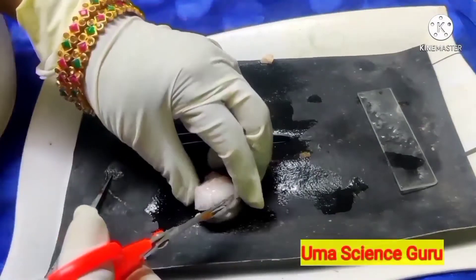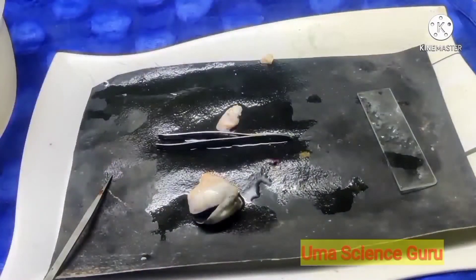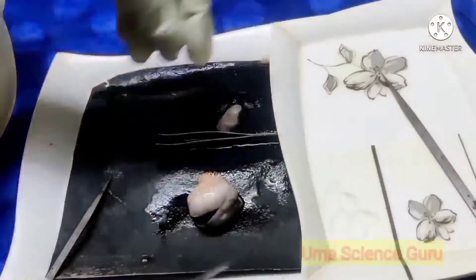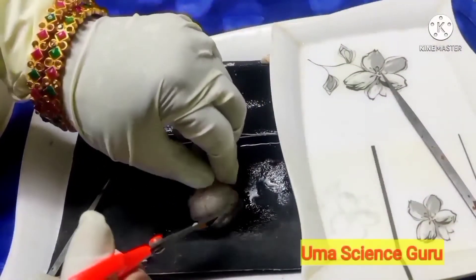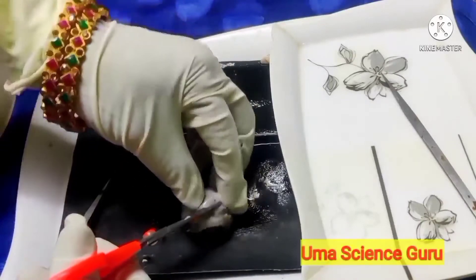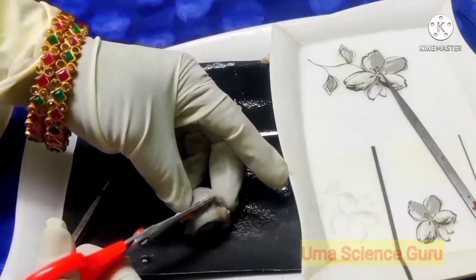In the front portion of the eye, the sclerotic layer forms the cornea. The cornea is the clear window in the sclera in front of the iris. It protects the eye from direct exposure to light.